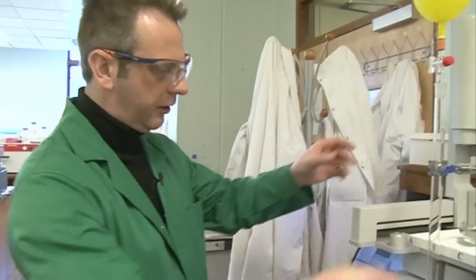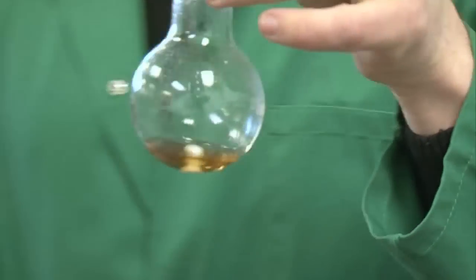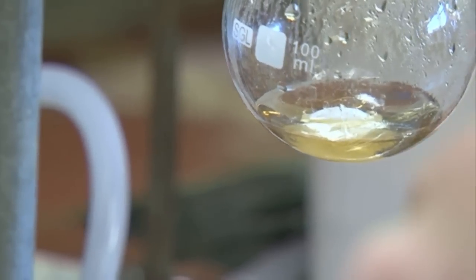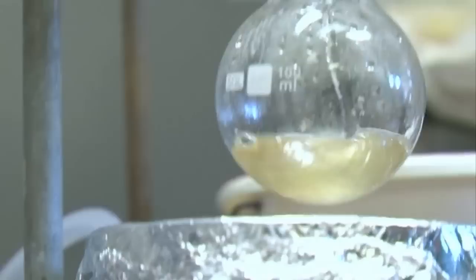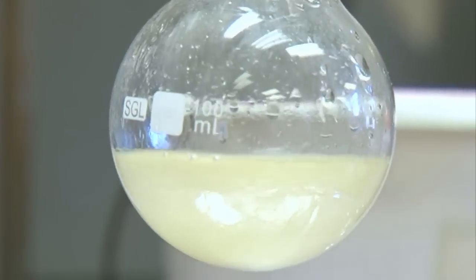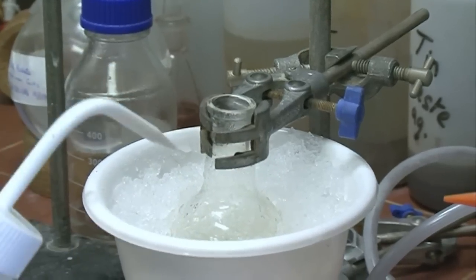We're ready to take it off the boil. It was all undissolved before — now let's see what it looks like. It's a clear oil, and I can smell vinegar — that's a good sign. We'll add about 20 millilitres of water, dropping it down the side slowly. That will destroy any remaining acetic anhydride. Turn the stirrer on a little bit. Now what we're trying to do is get the aspirin to crystallise out as a solid. Sometimes it happens straight away — not always. One way to do it really well is a crystallisation: heat the mixture very hot, then cool it, and the aspirin should crystallise out and give us some really beautiful crystals.